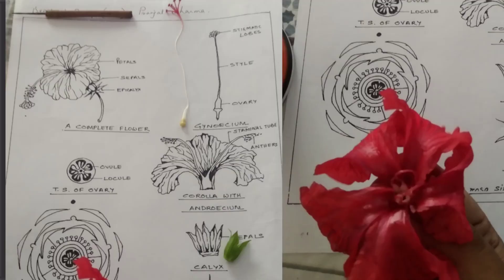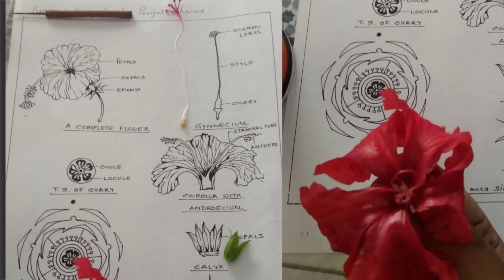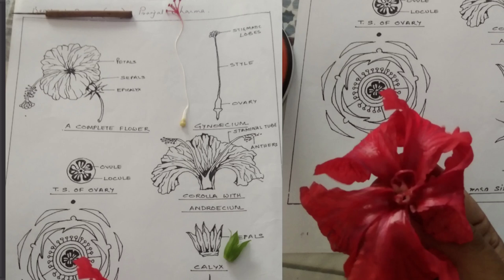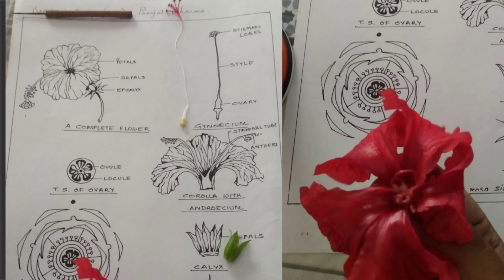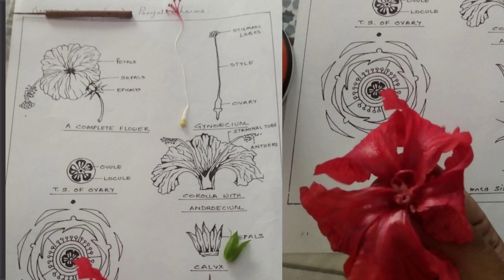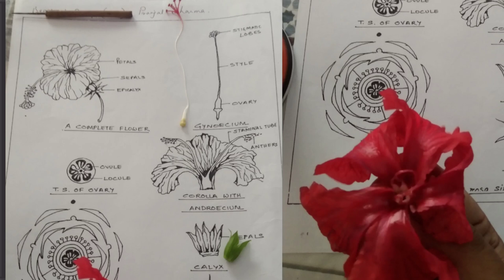Hello students, welcome to PRS Biology. Today I am going to discuss the practical dissection of the flower Hibiscus rosa sinensis, commonly known as the China rose. Its family is Malvaceae. It is very important for Class 12 students as it will come in your final examination. For practical examination, dissection of the flower is very important. I will show you how to properly dissect the different parts of the flower and maintain the drawing of the diagram in proper sequence.